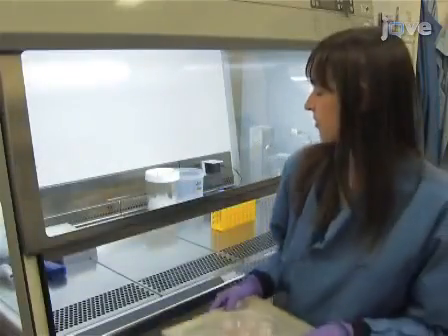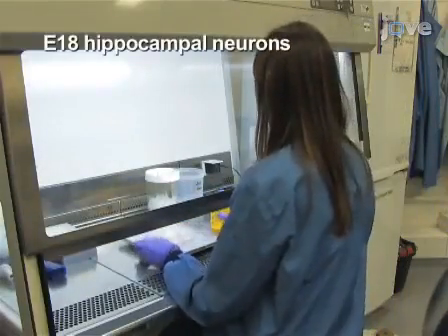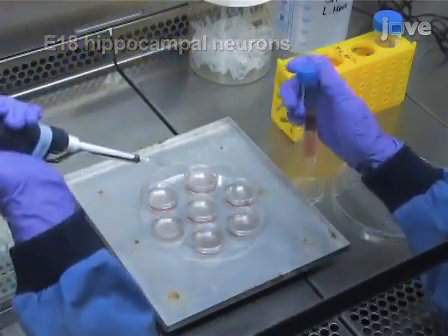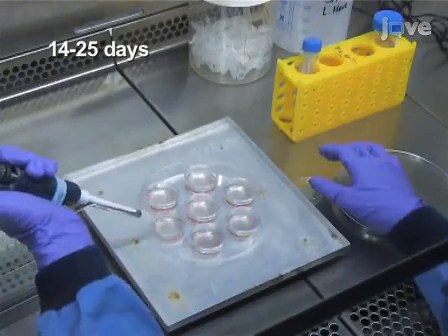To begin, culture high-density hippocampal neurons from embryonic day 18 rat pups on poly-L-lysine-coated glass coverslips for 14 to 25 days in vitro.